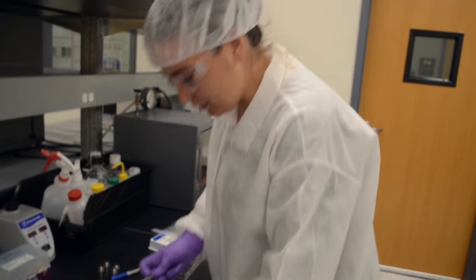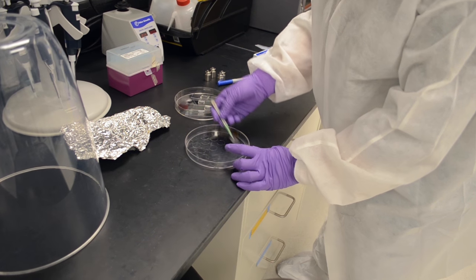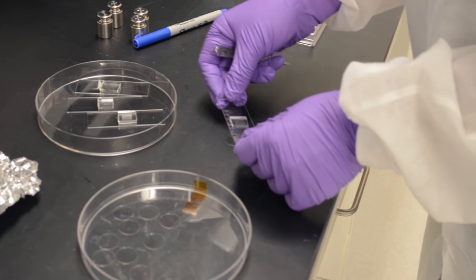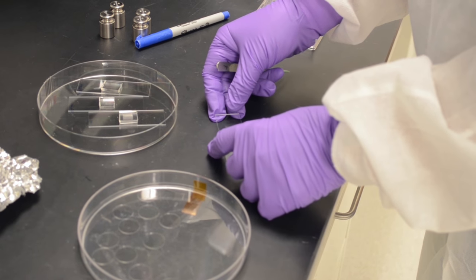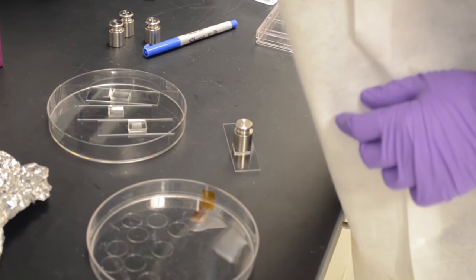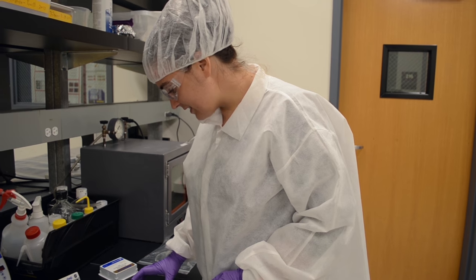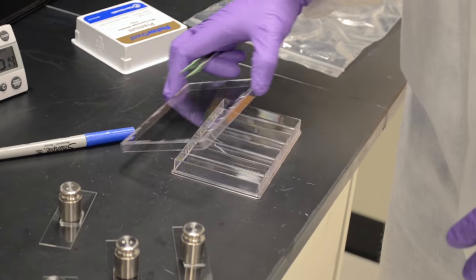So only the top of these is activated, right? So we're just going to pick up a cover slip. We're gonna take one of our patterns and we're gonna set it down. And then we're gonna put a little weight on top and start the timer. We're gonna do that for all of our devices. So 5 minutes have passed, and another thing I've done is label this dish that I'm gonna transfer these cover slips to.